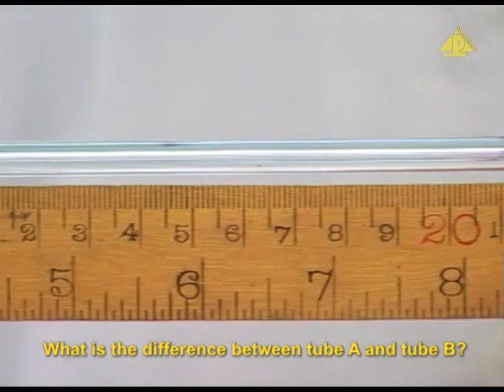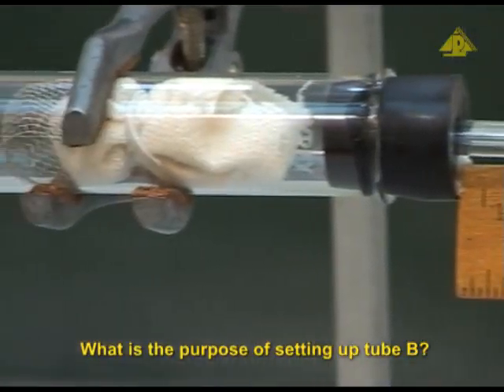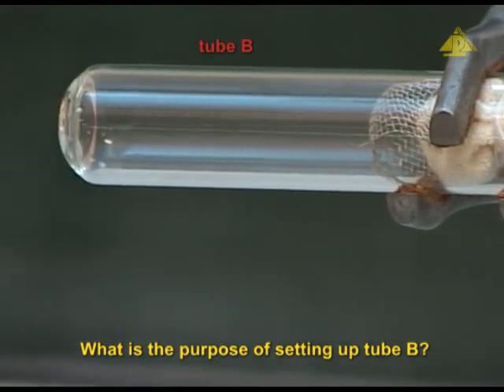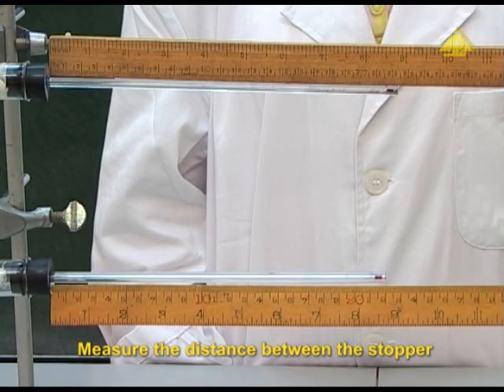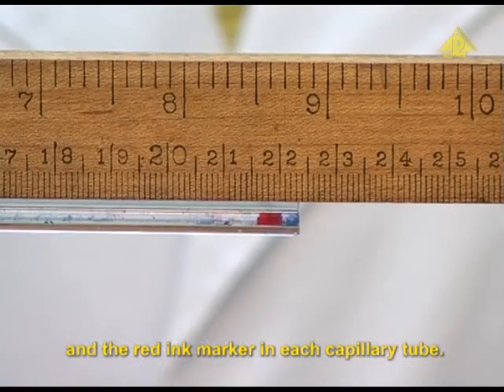What is the difference between tube A and tube B? What is the purpose of setting up tube B? Measure the distance between the stopper and the red ink marker in each capillary tube.